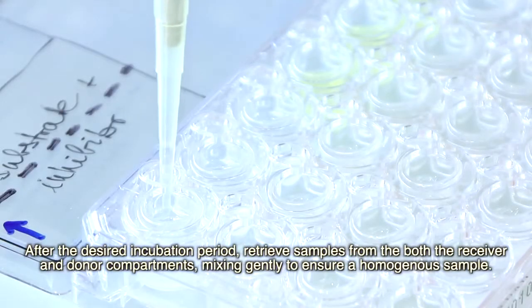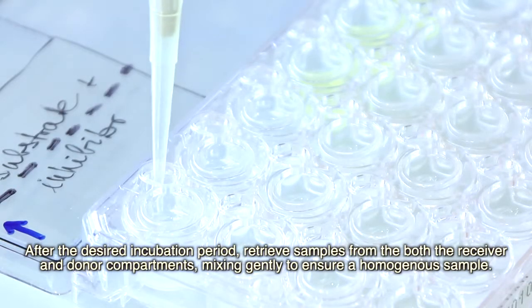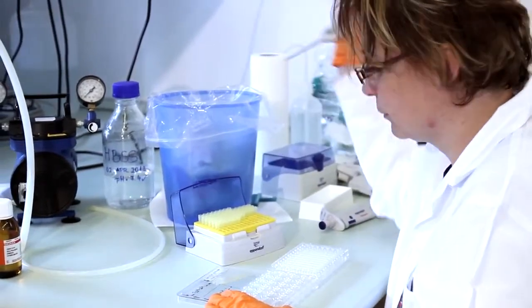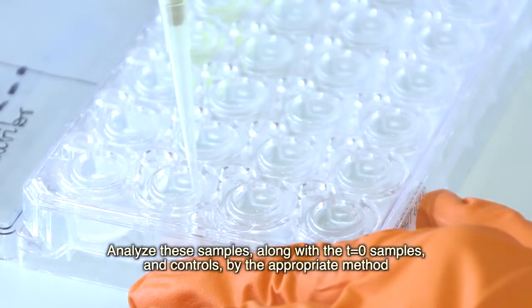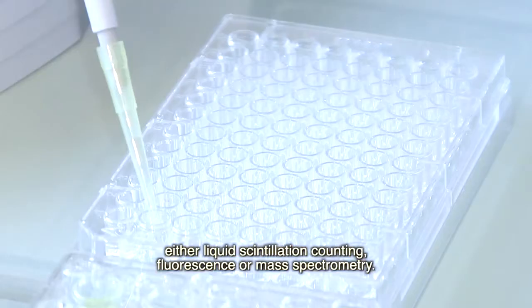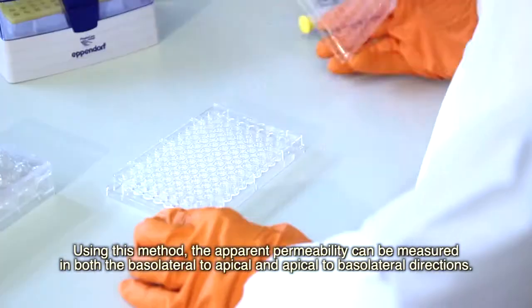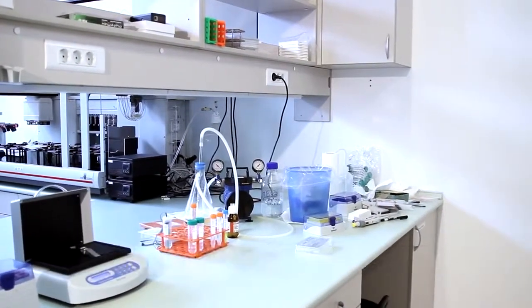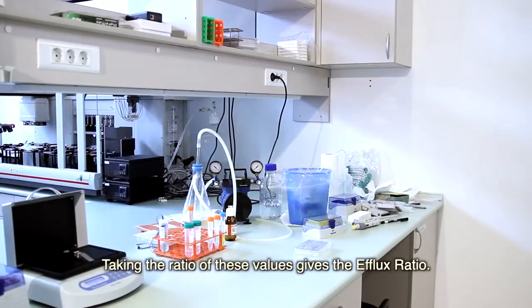After the desired incubation period, retrieve samples from both the receiver and donor compartments, mixing gently to ensure a homogeneous sample. Analyze these samples, along with the time zero samples and controls, by the appropriate method, either liquid scintillation counting, fluorescence, or mass spectrometry. Using this method, the apparent permeability can be measured in both the basolateral to apical and apical to basolateral directions. Taking the ratio of these values gives the efflux ratio.